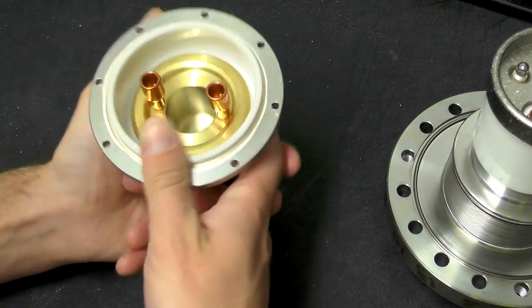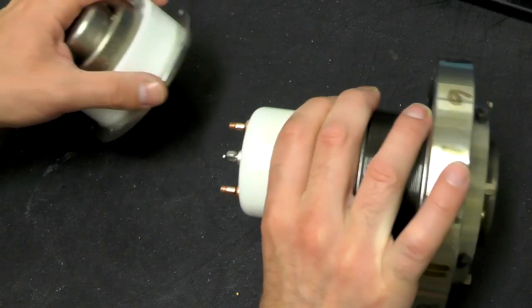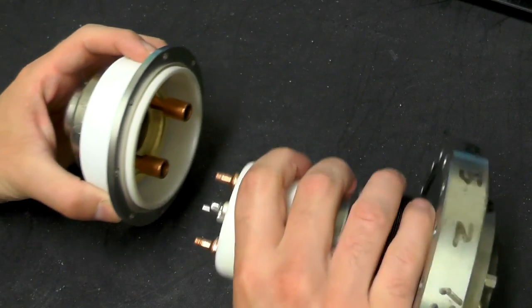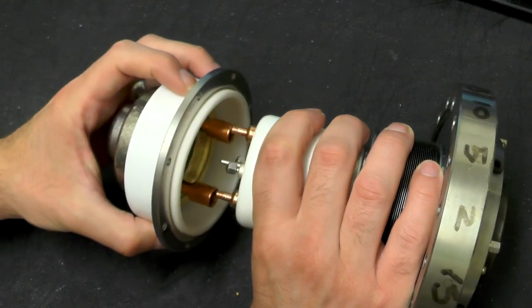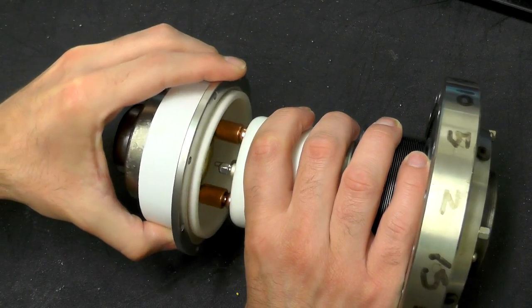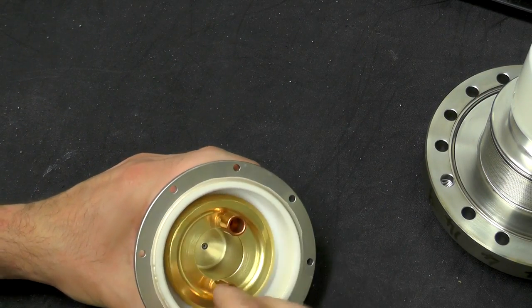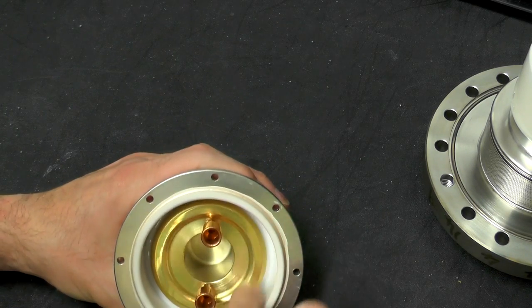The next part down — if you imagine the filament attached here and pointing down, it would have inserted inside this part. These two connections plugged into little terminals making contact so the filament would have been deep down inside this part. This is all metal.